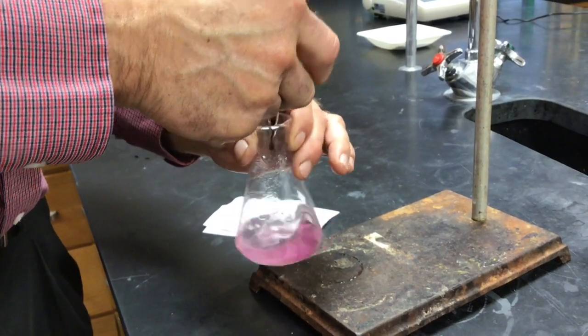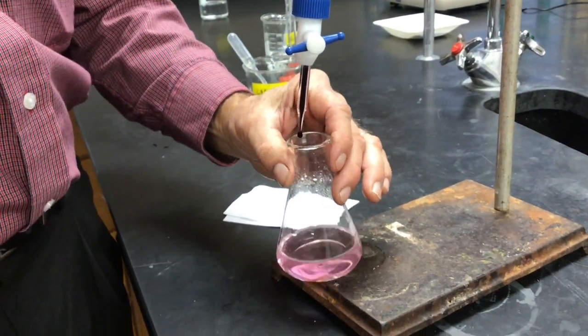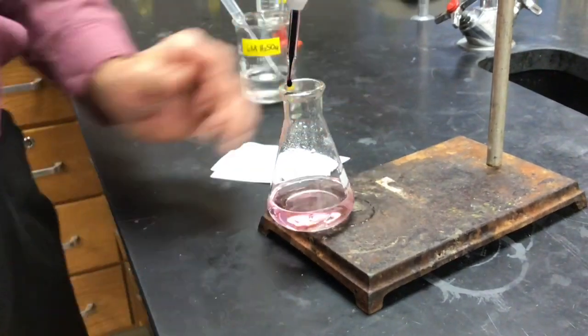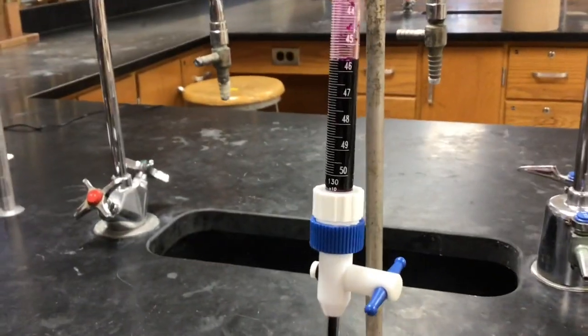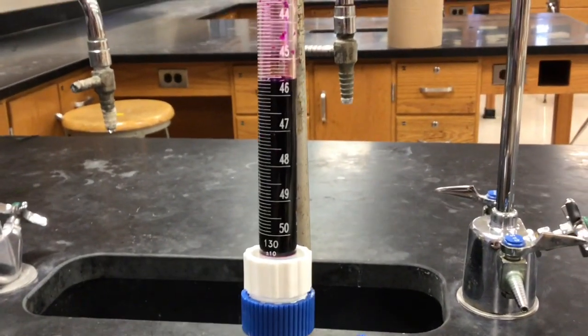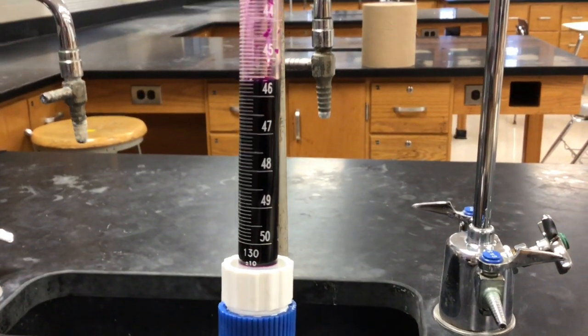Ooh, is that it, Mr. Moore? I think that's it. And here we are down at the bottom part of the burette.